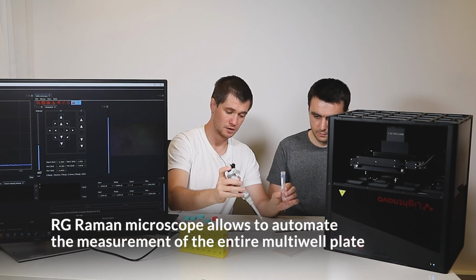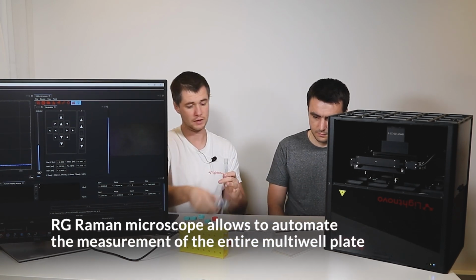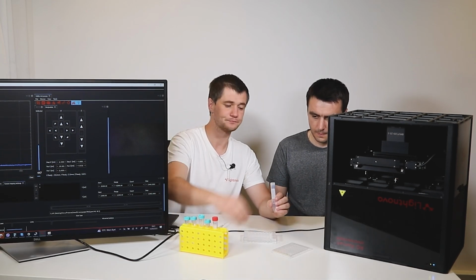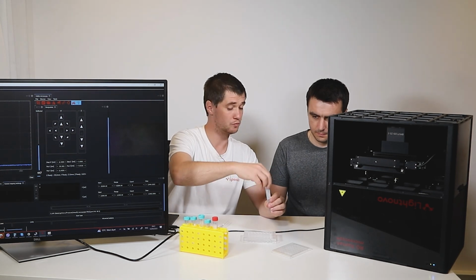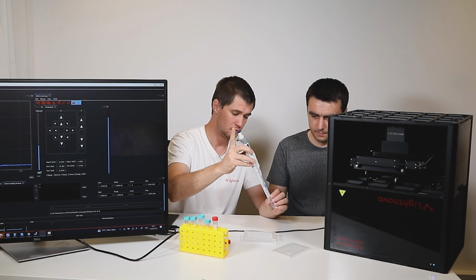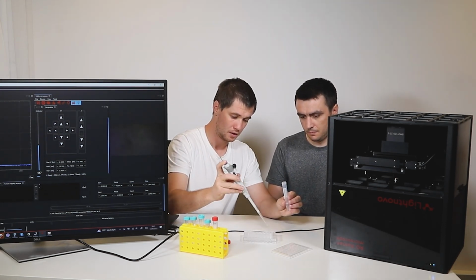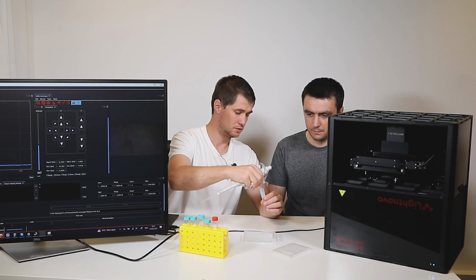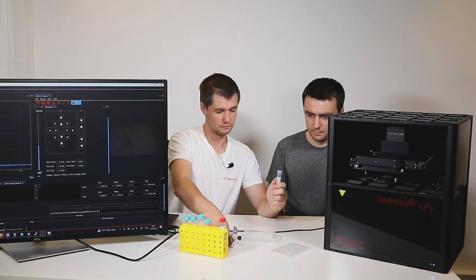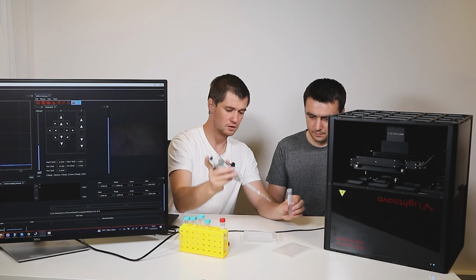And by the way, our Raman microscope allows automated measurements of the entire multi-well plate. And let's say we want to make a calibration model with multiple points of the same concentration. So we will insert F2 for concentration 40, E2 for concentration 20, and so on.